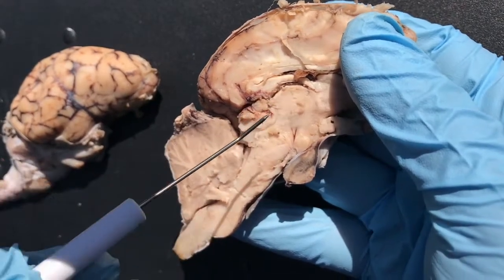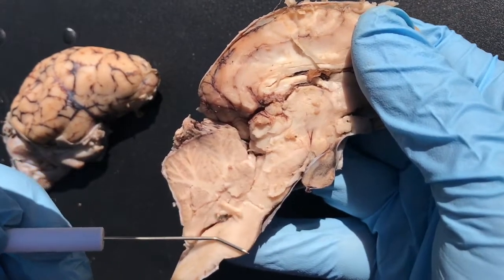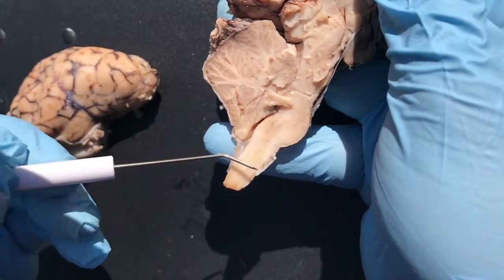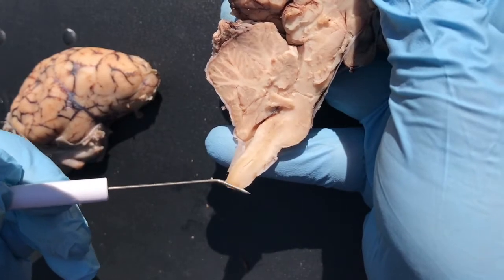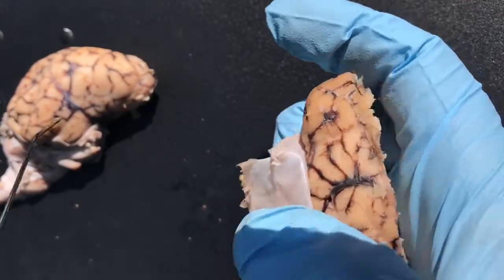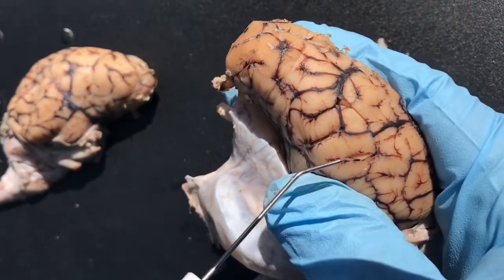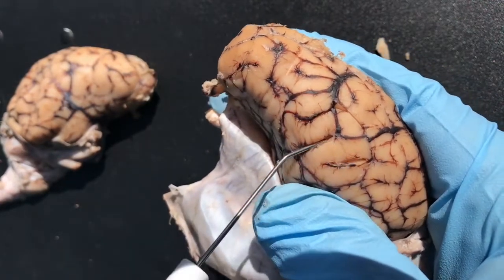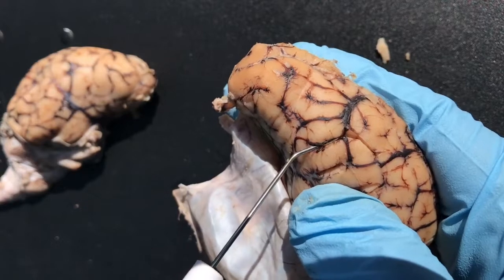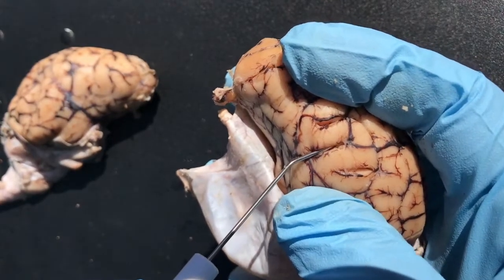So this is the thalamus here and this is the hypothalamus. This is the tegmentum, the pons, the medulla oblongata, and then finally the spinal cord. And we have our sulcus — here are a bunch of little valleys, a bunch of sulci, and here's a gyrus. A gyrus — that's the little hills. Hills and valleys: the valley is the sulcus, and the little mountain is the gyrus.